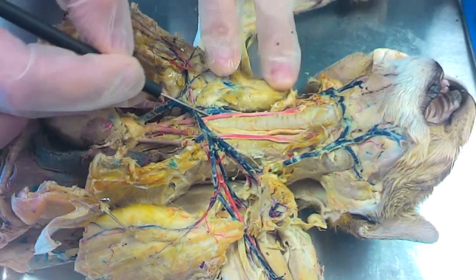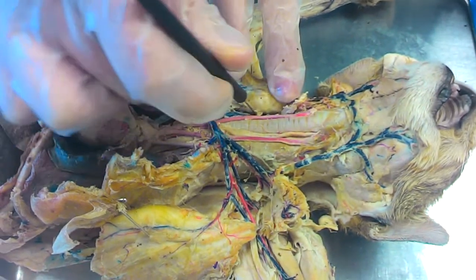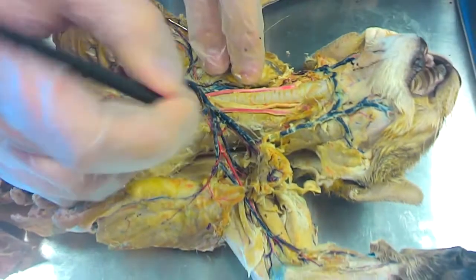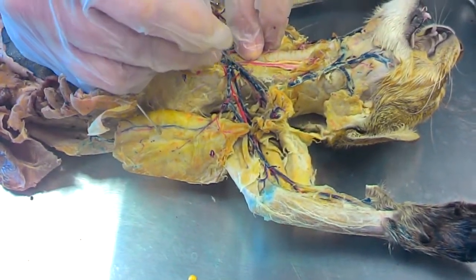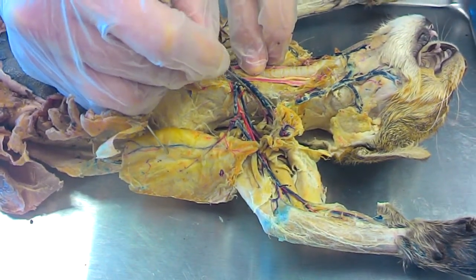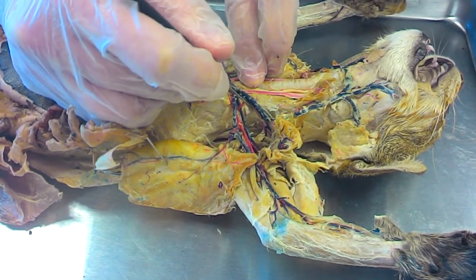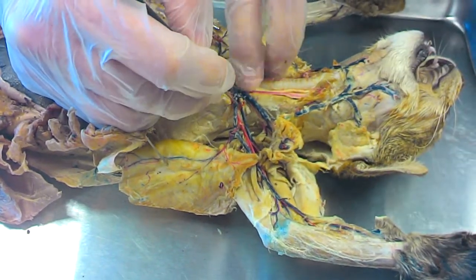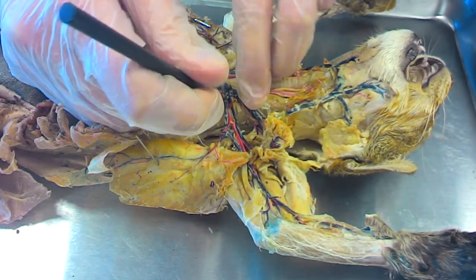The jugular, and off the jugular you have the transverse scapular, which goes to the back to the scapula. Over here, off of the brachiocephalic, you have the jugular. Tracy, what's the one that's right underneath the subscapular? Thyrocervical artery. Then here we have the subscapular again that goes to the back to the scapula.